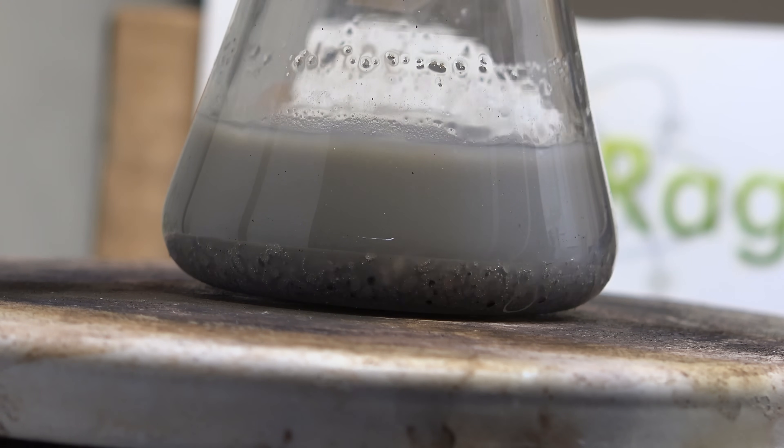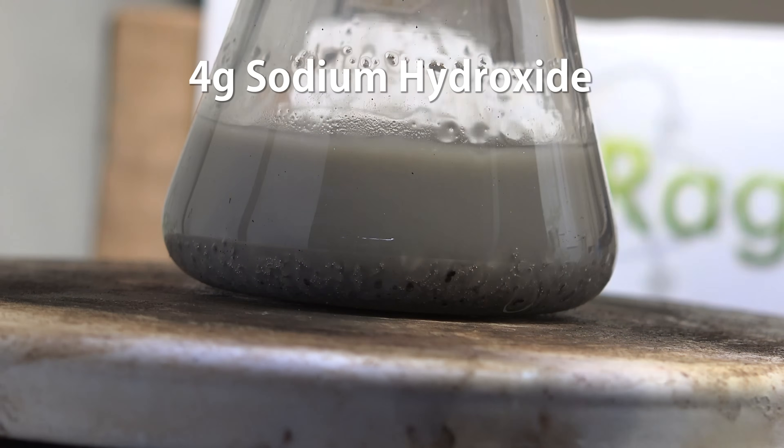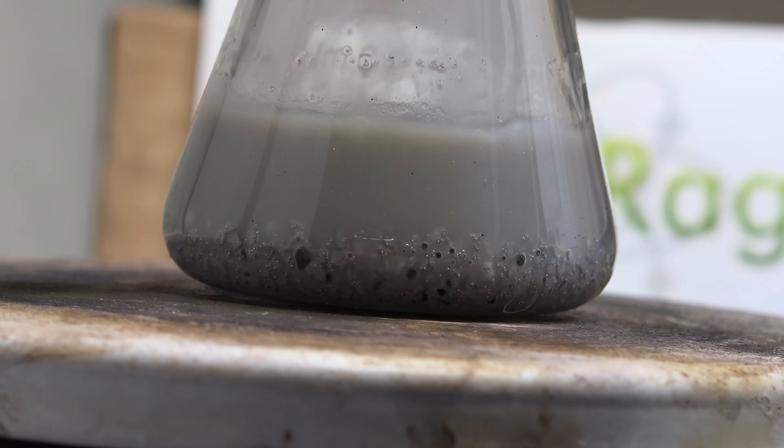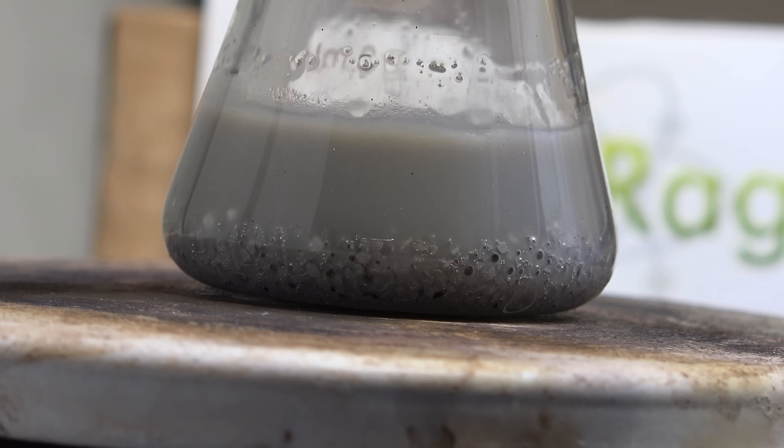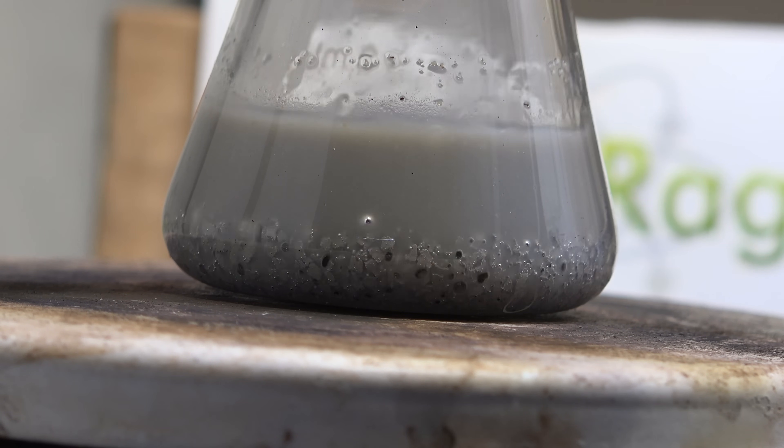This should be at least 200 degrees celsius in there, most likely higher. Now we drop in 4 g of sodium hydroxide and let it react. Okay, these conditions don't get much more ideal than this. Sodium jumpstart, high quality magnesium and an alcohol that has been engineered to be the perfect catalyst and solvent at the same time.